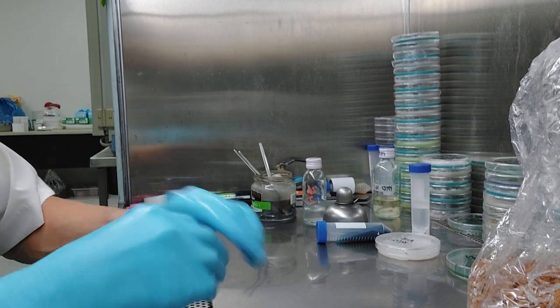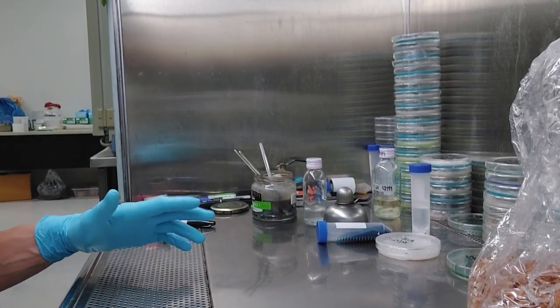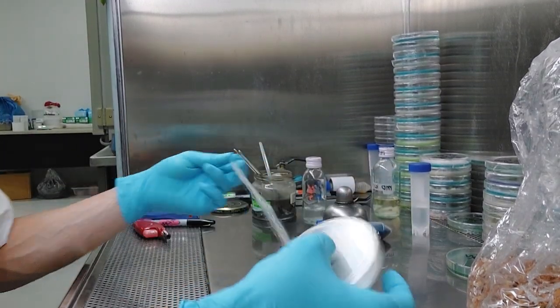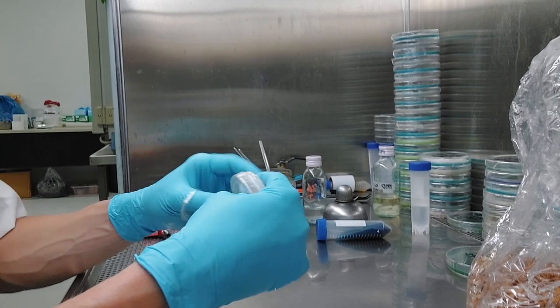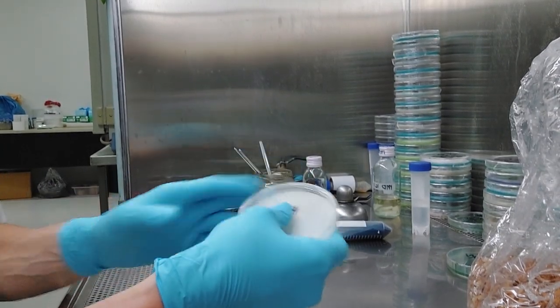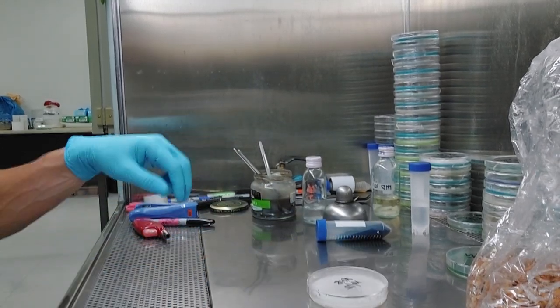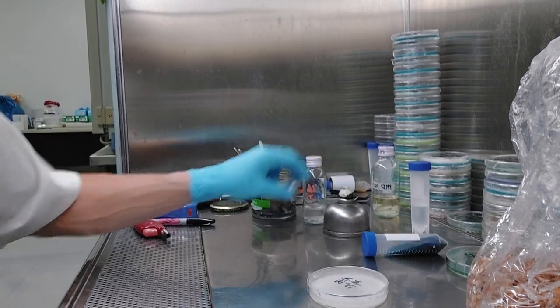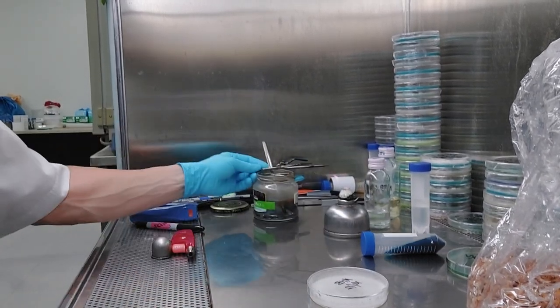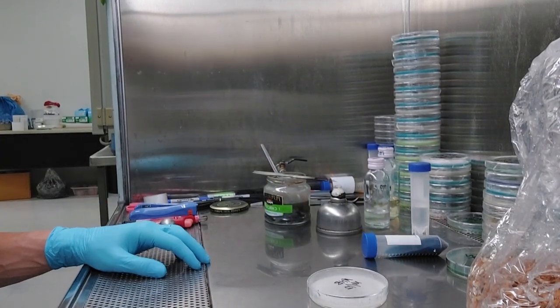There's not really multitasking is a bit of a misnomer. Nobody really multitasks. You have to do one thing at a time. So when you do those things in an organized order, like unwrapping your petri dish before you get started, and then I'm gonna flame my scalpels, and then get my spawn bag ready. So here we go. I've been through a lot of this already, so I'm just gonna kind of do it this time. If you guys have questions later, that'd be great.